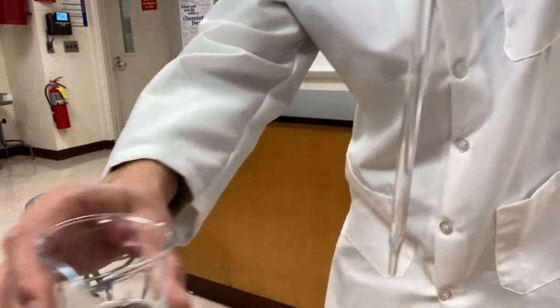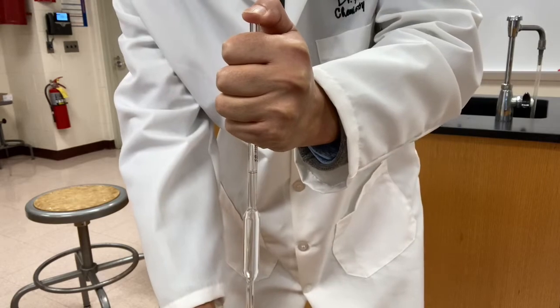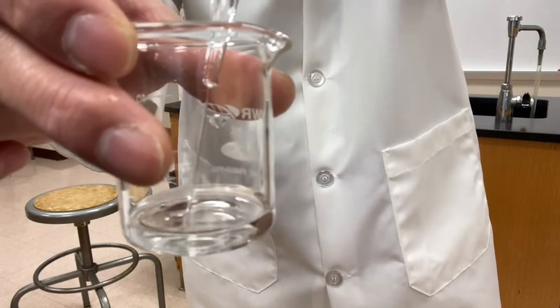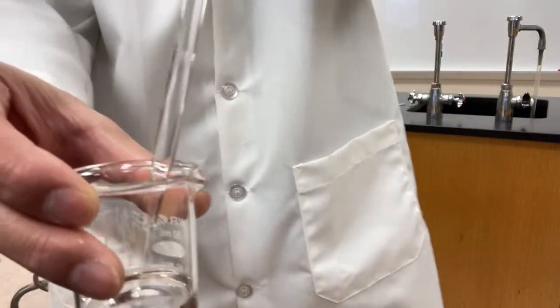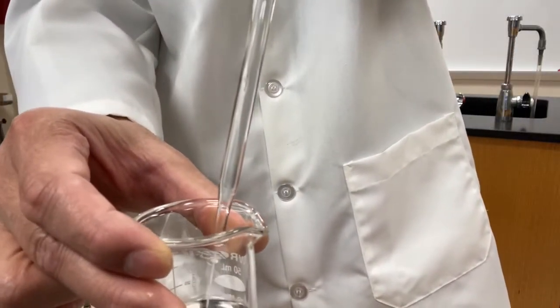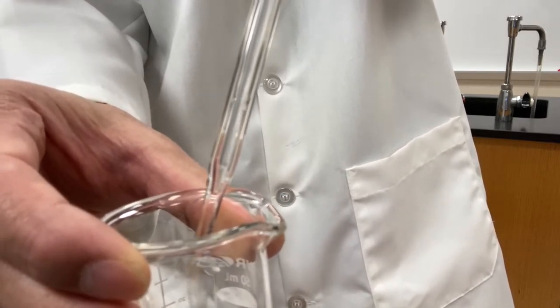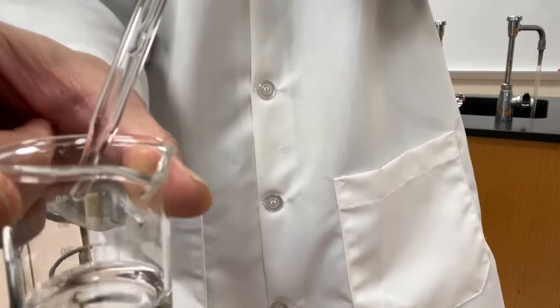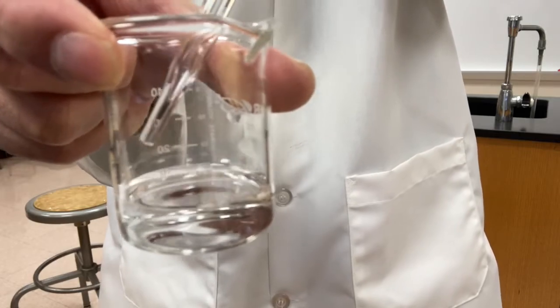All right, 10 milliliter. I'm going to transfer it. Now, what I'm going to do, I'm going to move my thumb away, and the liquid is coming out. Okay, liquid doesn't drop out anymore. There might be a little bit of liquid at the tip here. I'm going to use the tip, let it touch the wall of the beaker. That's it.